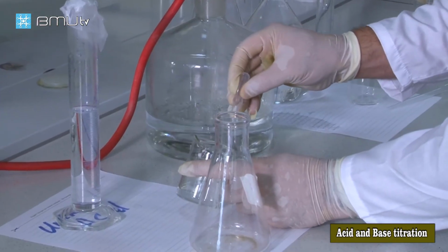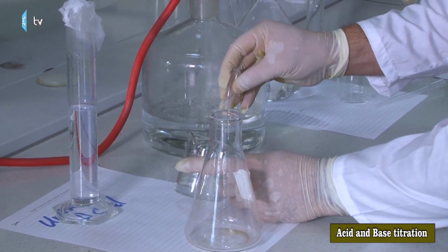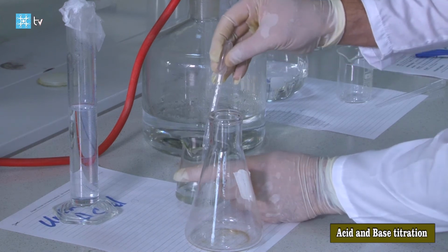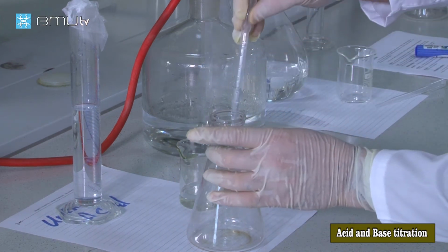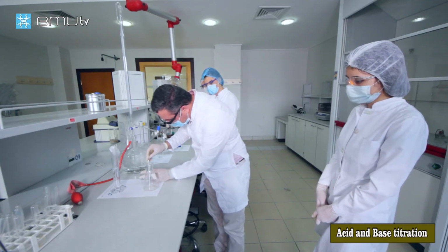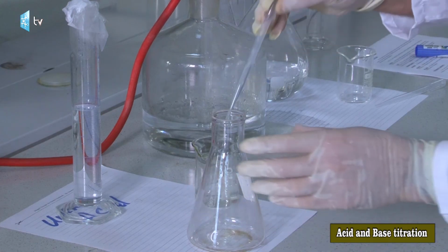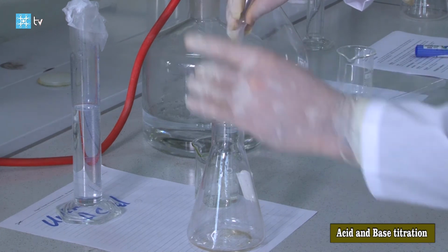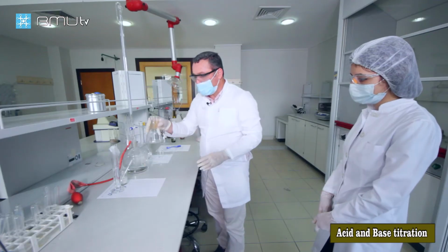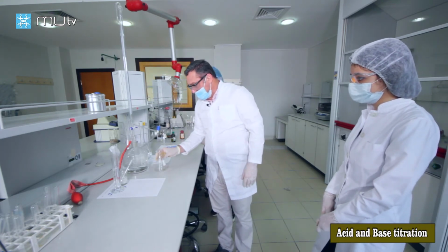This is enough for our experiment. Now in the Erlenmeyer flask we have 3 milliliters of unknown acidic solution.